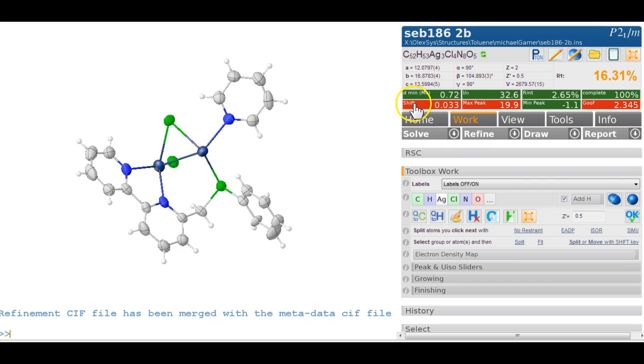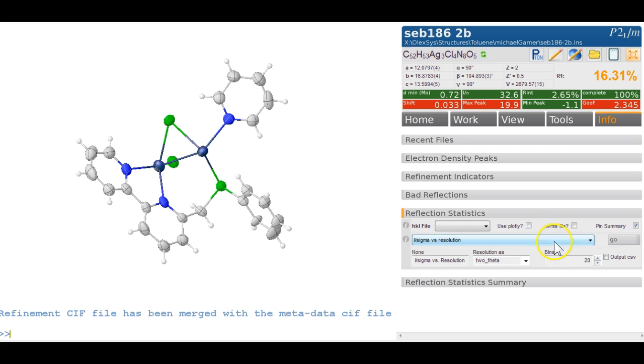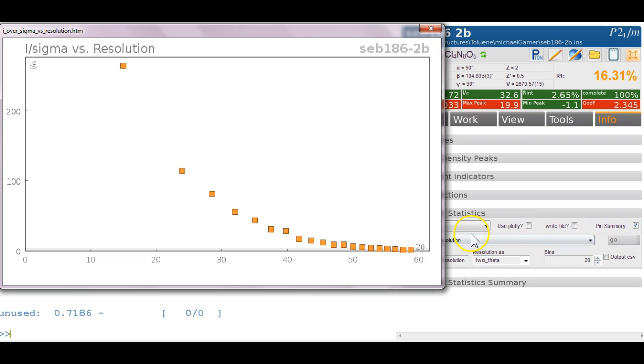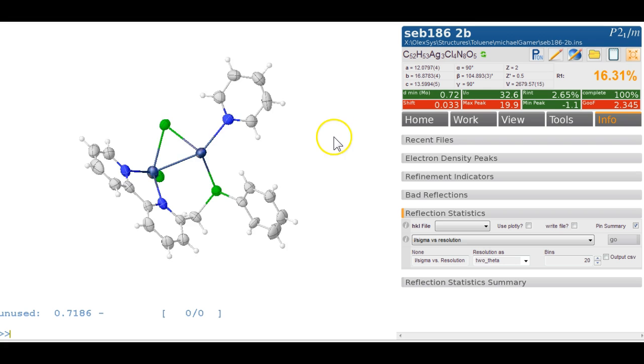And let's have a look at the data. It's a good high-resolution data set in Molly, I over Sigma 32. Now, what does that actually mean? Let's have a look at the stats, I over Sigma versus resolution. And yes, a really, really strong data set. So the I over Sigma 3 line is all the way down here, so all the data are very, very good. And it's highly consistent, 2.65% R-int.